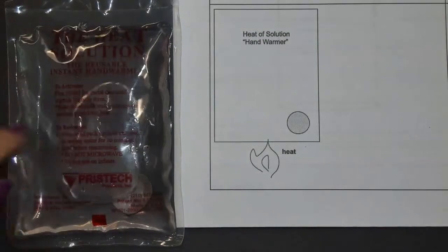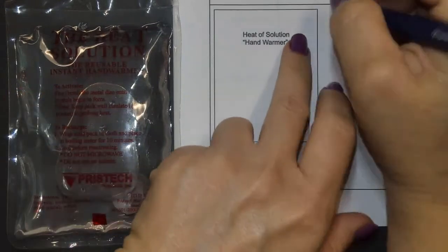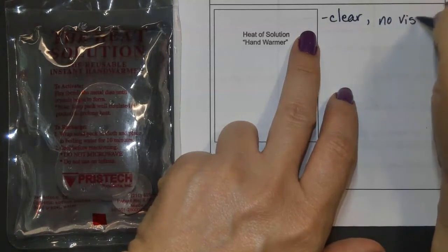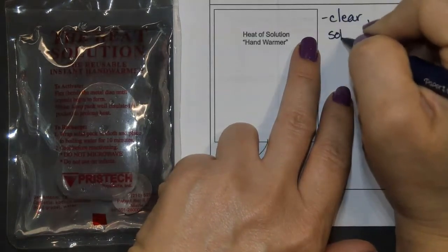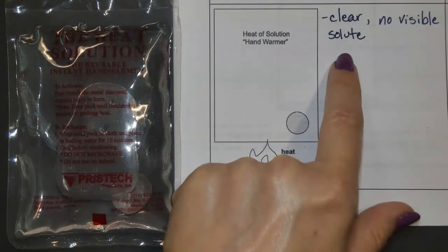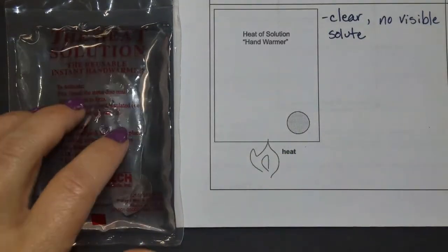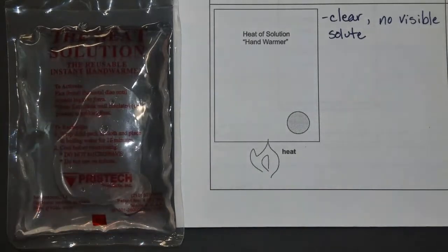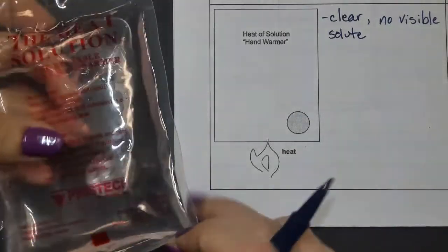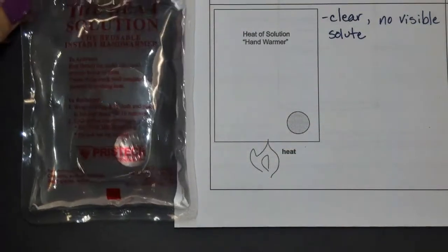So now we've taken it from the boiling water, we've heated it, we've redissolved all of the solute. This is now clear with no visible solute. However, this was the situation with our supersaturated solution earlier, if you look above. So how can we know whether or not this is supersaturated? And the way you can know is we can flex the disc just like we did before. And when we flex the disc, you're going to notice nothing happens.